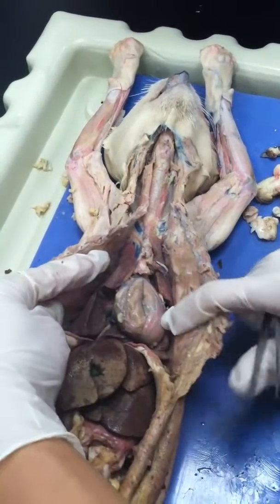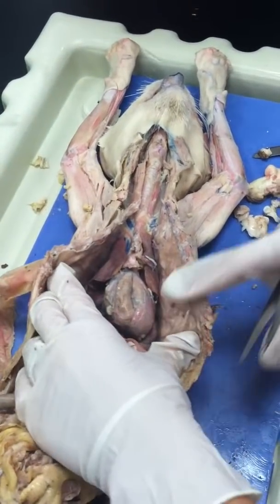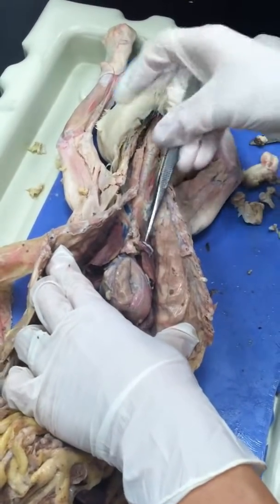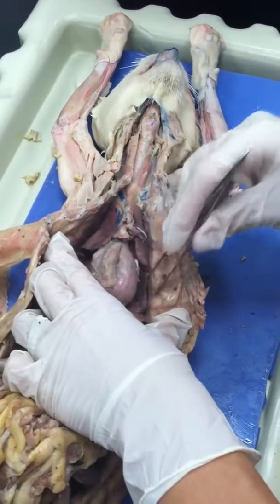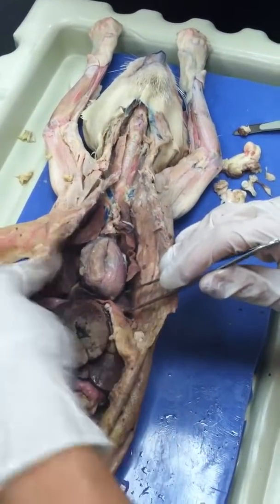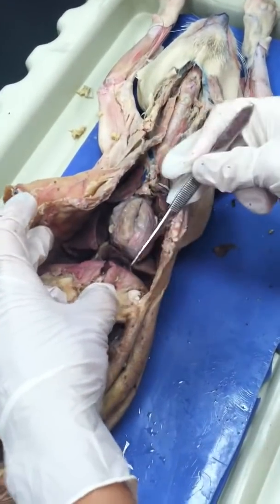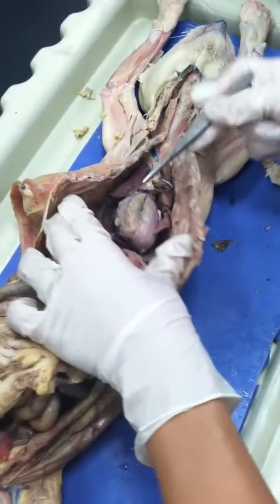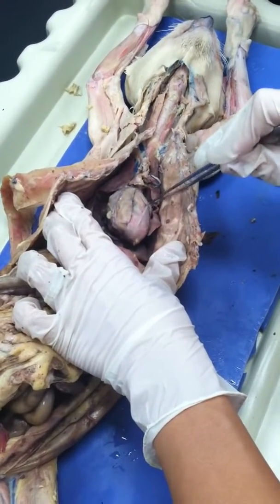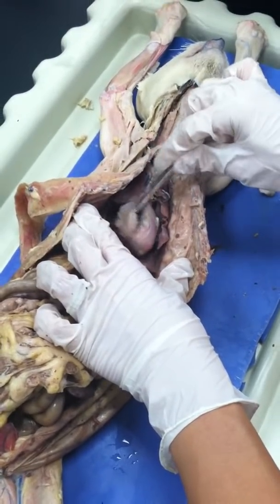Excuse me, doctor. Can you please speak a little bit louder? That doesn't get transmitted. Okay. So the two lungs, as you see, have more than 3 or 4 lobes. Below the lungs are the diaphragms, these two, and then you have the heart covered by pericardium. It's difficult to find any of the details of that heart.